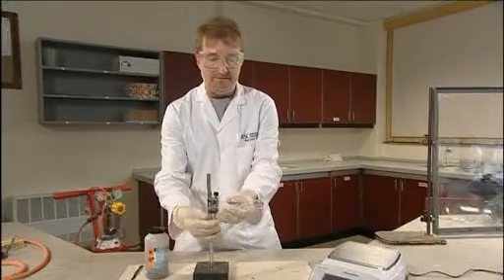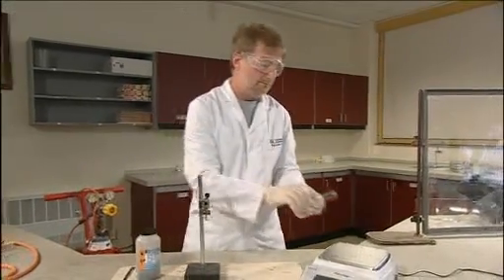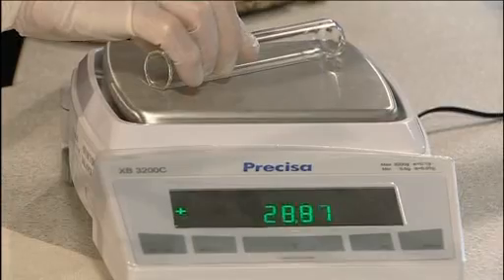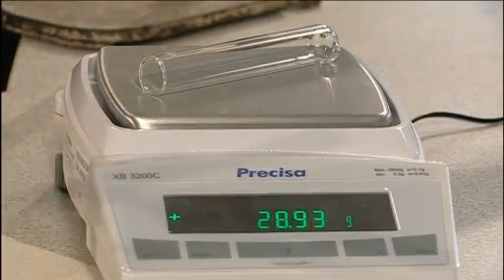We first need to weigh the empty reduction tube. The balance used must read to at least two decimal places.